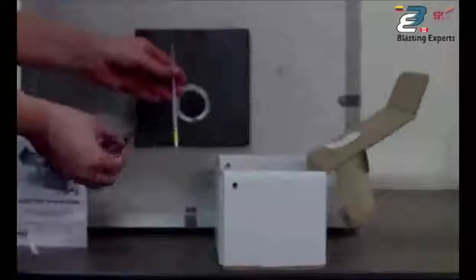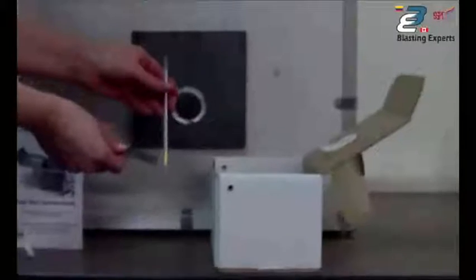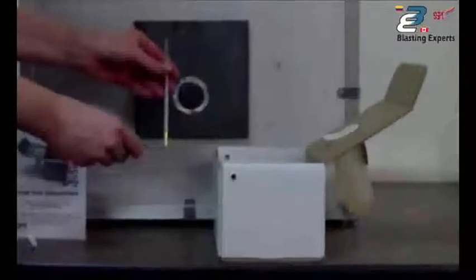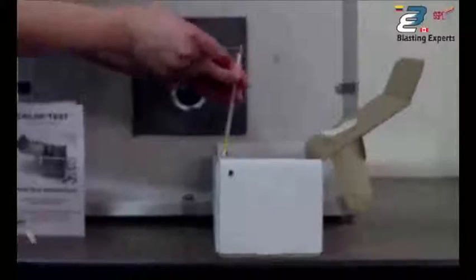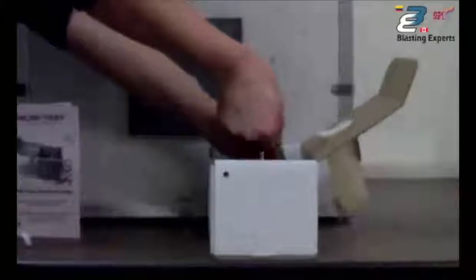Now take that glass tube and you'll see the yellow end, the bottom is yellow, got yellow stain in it. That's the end that goes down. Snap off both ends of the tube with the snapper. You are breaking glass, so be careful of your eyes and your fingers. Push the tube all the way down into that hole and then just snap it off. Now, just drop that down into the extract.